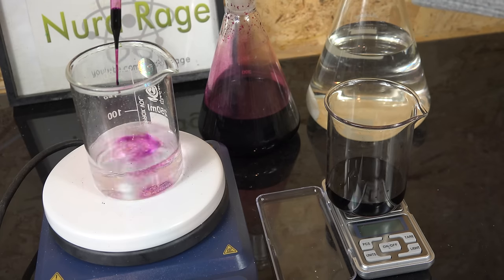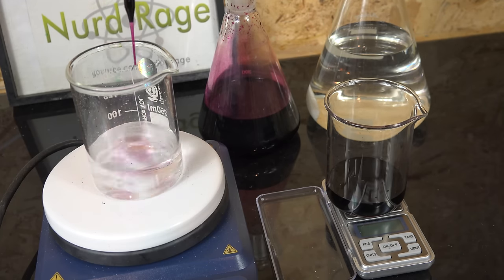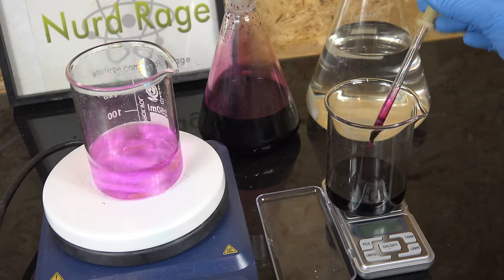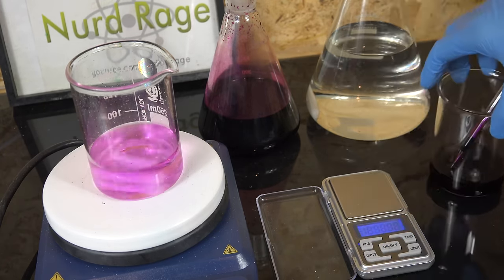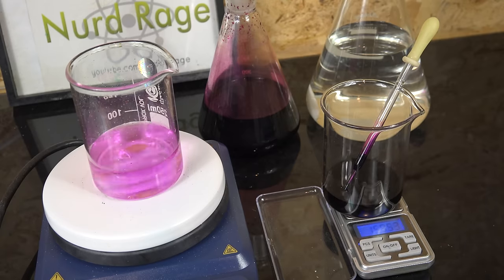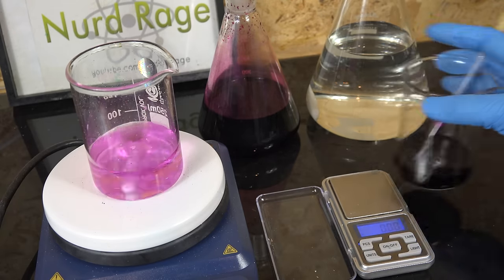So as long as you're not taking hours to perform this titration the decomposition isn't an issue. And we are done. My particular peroxide just needed about two grams of titrant. As usual we do three trials to get a good average and make sure we didn't screw up a particular one.